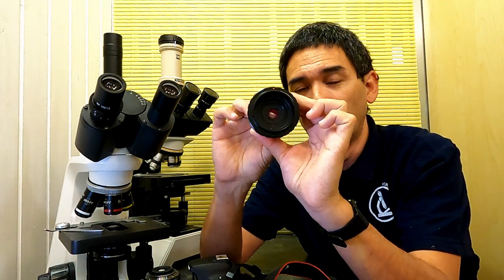I'm kind of getting ahead of myself. So this is a problem. And the second problem is, this has no function, in other words. And the second problem is, and that's even worse, it's not parfocal. So this basically means that when I connect the camera, it's so out of focus that it's not even usable. You have to refocus so much that it's forget it. Yeah. So essentially I have no use for this adapter.